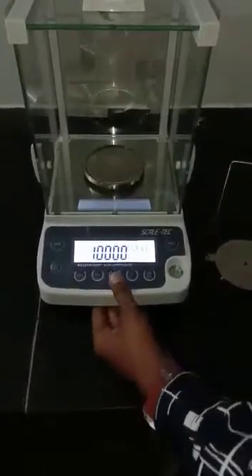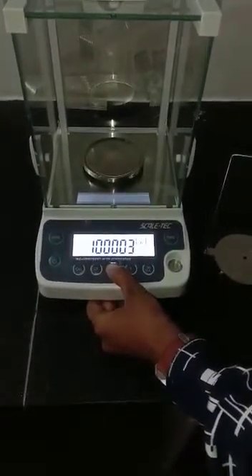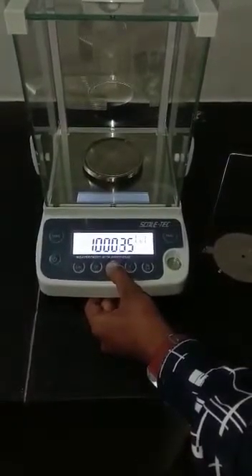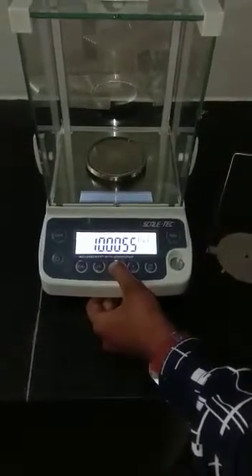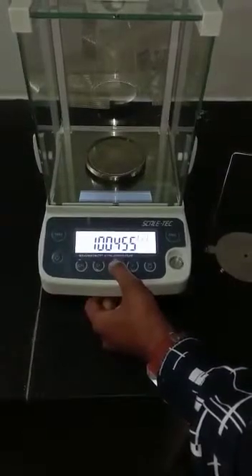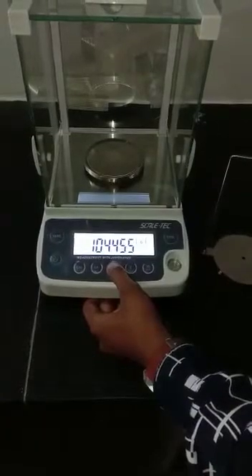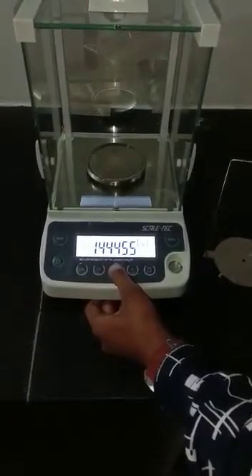Long press on the menu key and you will get the different digits on your display. If you release it, your cursor will move and you can put any value depending on your requirement or depending on the liquid you are using for the density measurement.